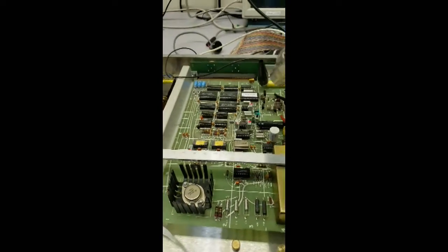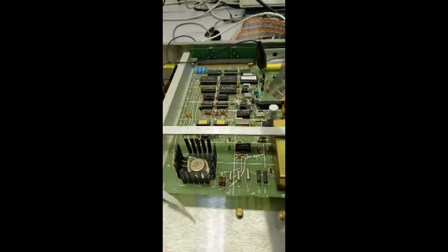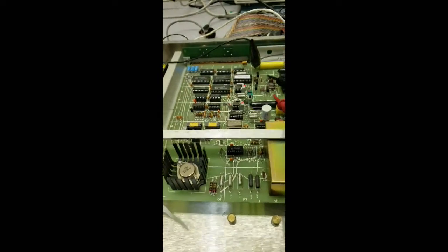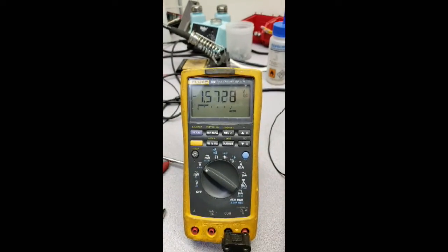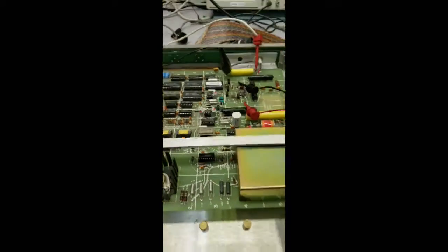Very close to doing it. There we go. Okay, so now we can hear the clicking. We can see that our voltage is about 1500 volts or so and oscillating. Our fine supply is all over the way at max, and now it's stabilized. So just in those few seconds it came back. All right, it's cooled down. So let's try it again.